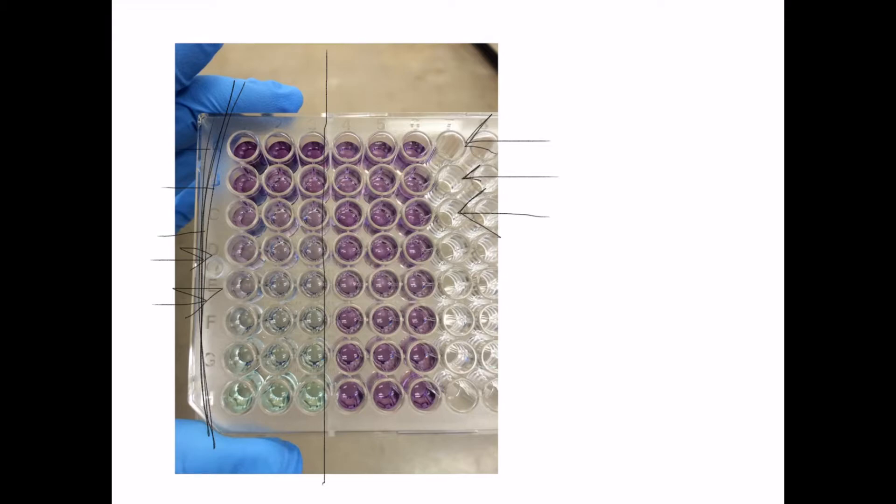So you can see here, this is the most concentrated of the standard curve right here, because it's the most purple, and each of these dilutions that have been prepared to create this curve, which will be used in calculating the concentration of our unknown sample, are progressively more dilute.